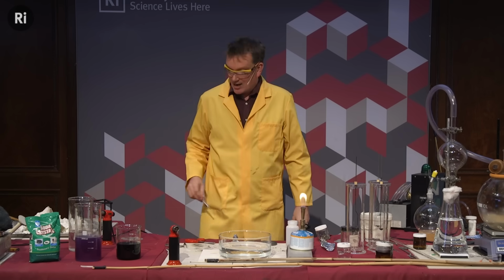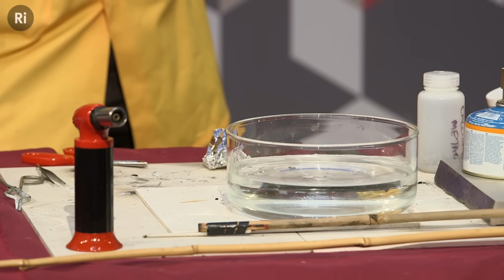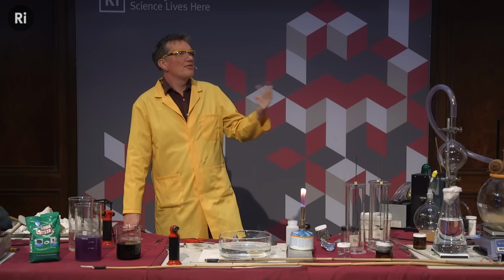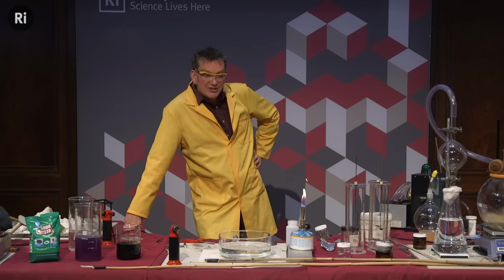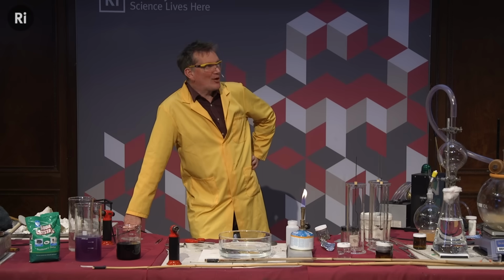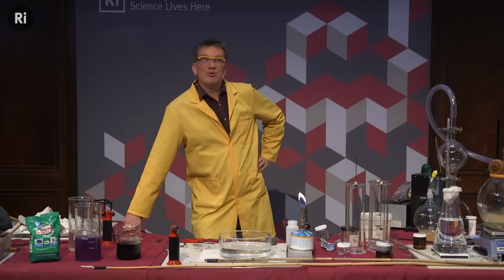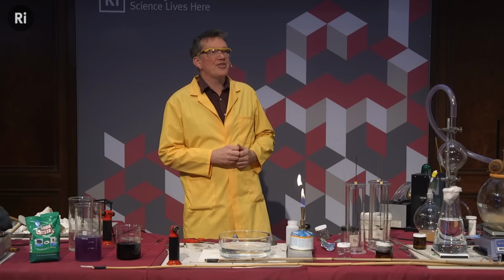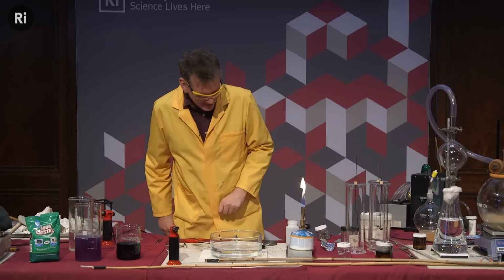There it is. Now, remarkably, this floats on the surface of the water. And this is because, well, this is element number 3. It's only got 3 protons, 3 electrons, and some neutrons. It's actually light enough, less dense than the water, it floats on top. But it doesn't mean to say it would make a good material to make a boat out of because, well, actually, it's now disappeared. It's reacted with the water to form lithium hydroxide. Okay, so we formed lithium hydroxide and hydrogen gas. Okay, completely disappeared.